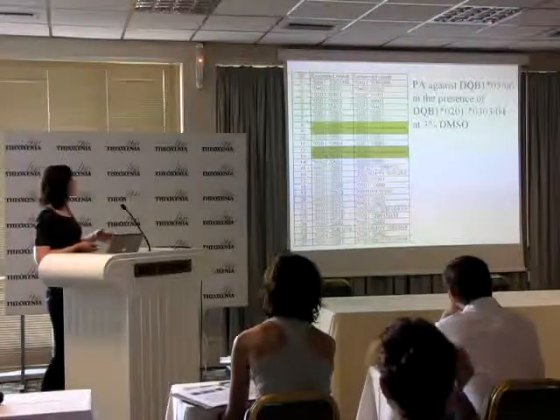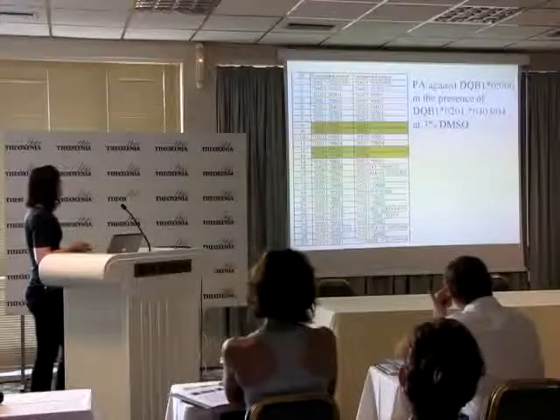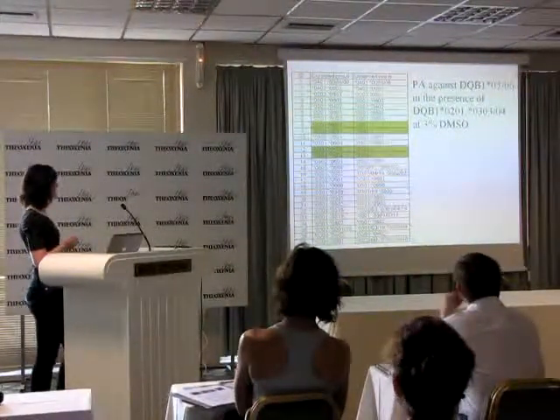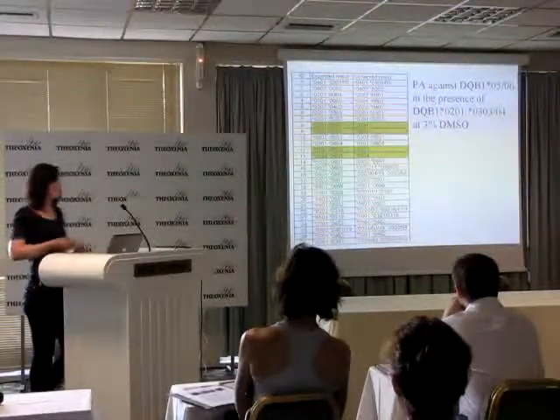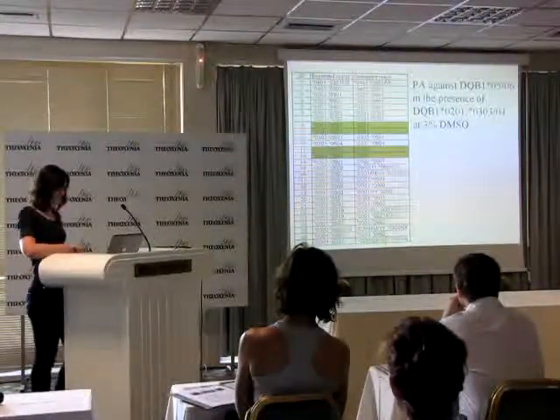So then I re-amplified and sequenced the panel again. Unfortunately, I was now getting PA against my 05 and 06 in the presence of the 0201, the 0303 and 0304.